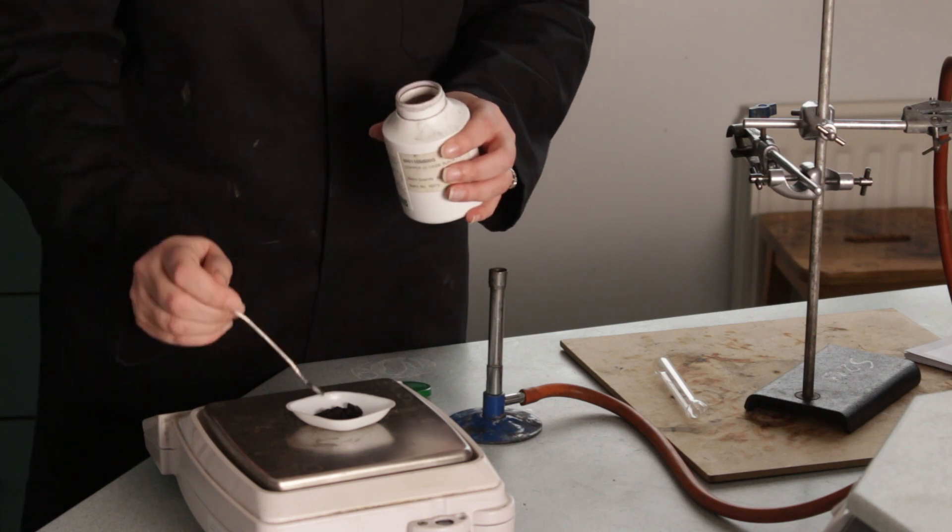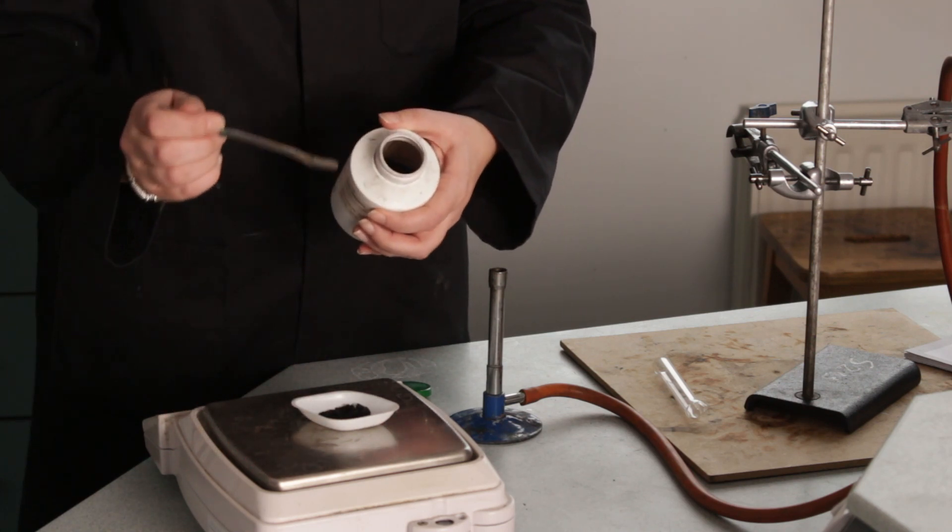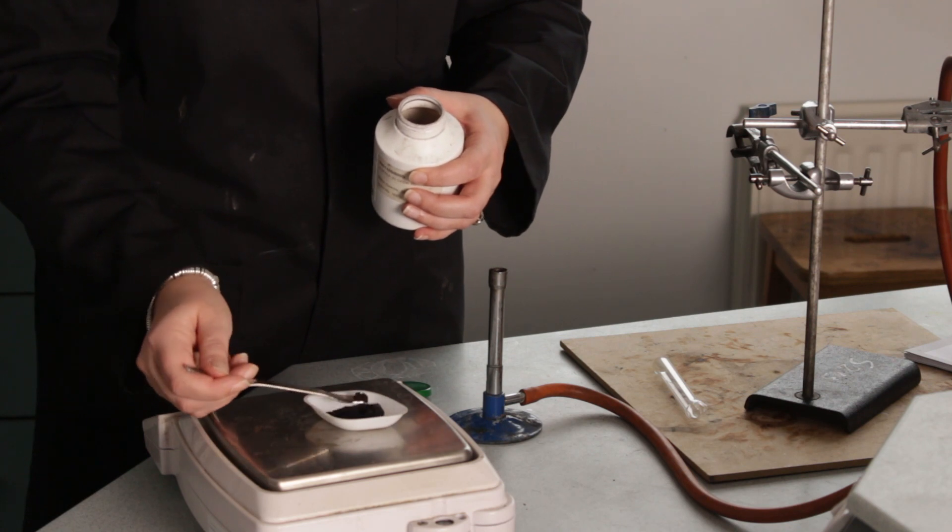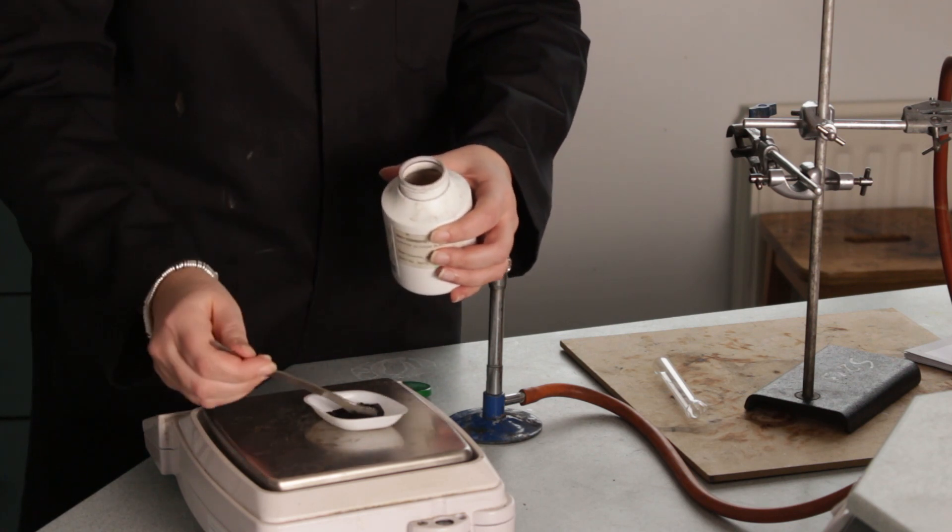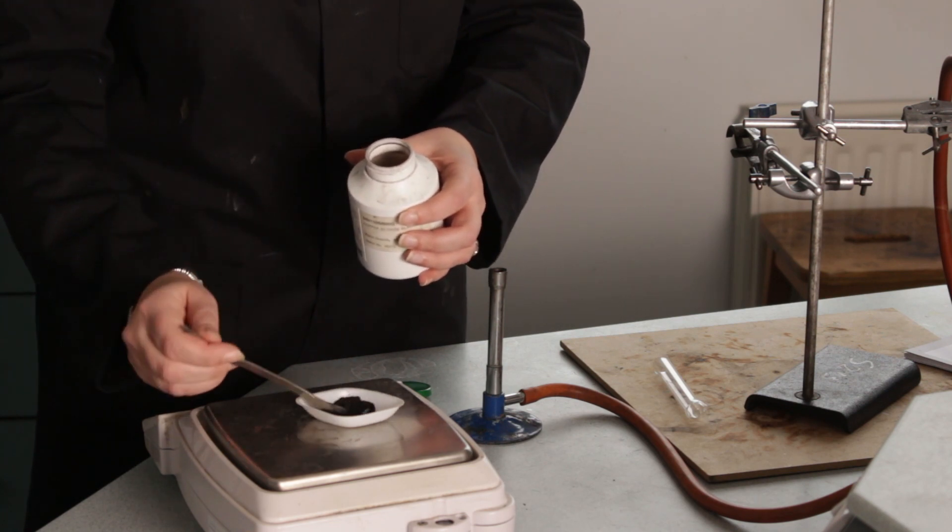Now you have to be careful. This powder can be a little bit of an irritant and it's quite messy. So I'm just going to make sure that I've got two grams. I've gone a little bit overboard so I'm just going to take a little bit out.